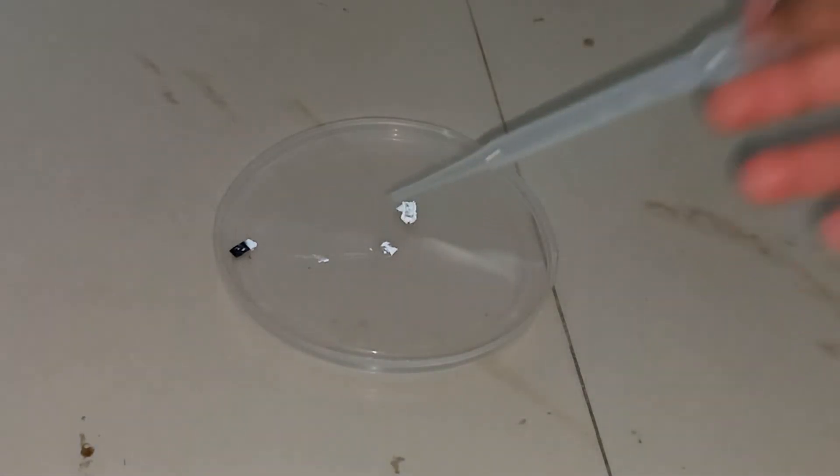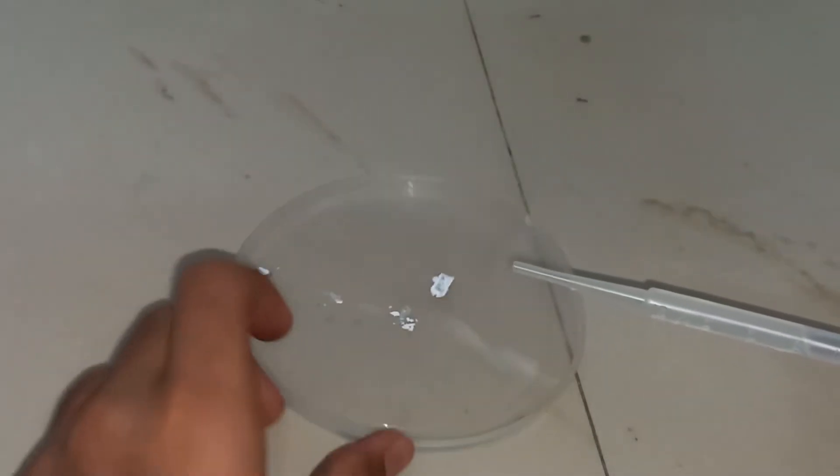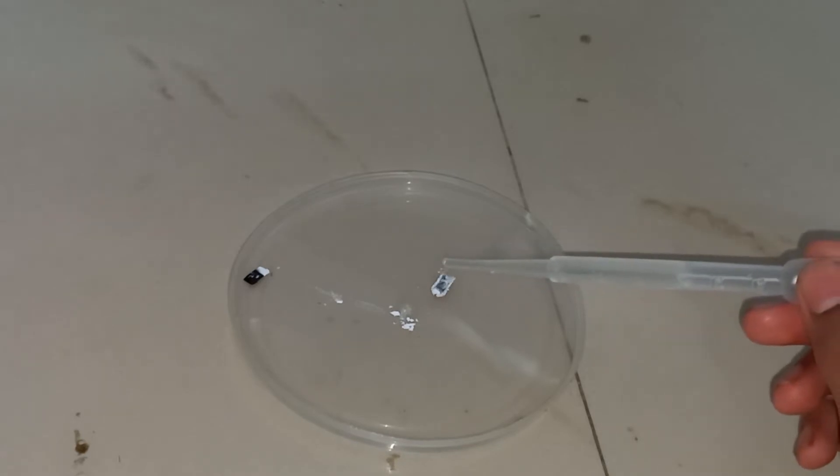So I will add some water to it and then we have to wait for some time. Later we will see something cool. Okay, so I got water and now I will add a little water to this. Okay, so this much water is enough and then I will leave it.